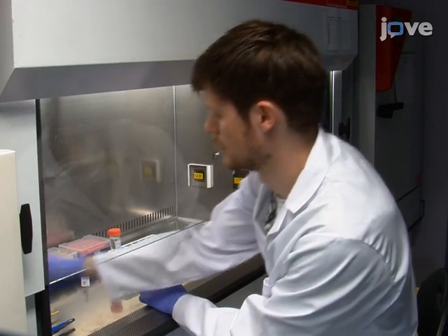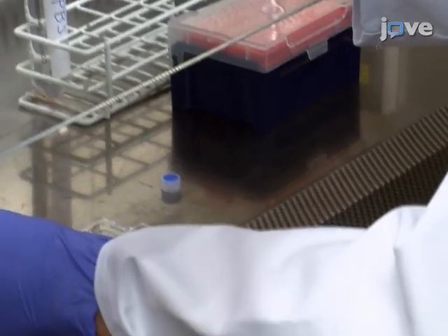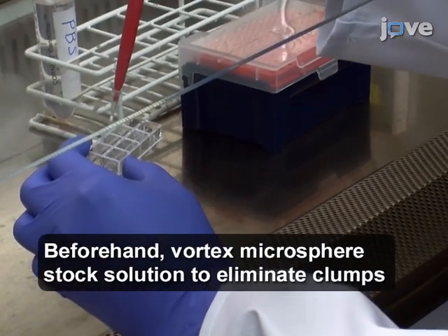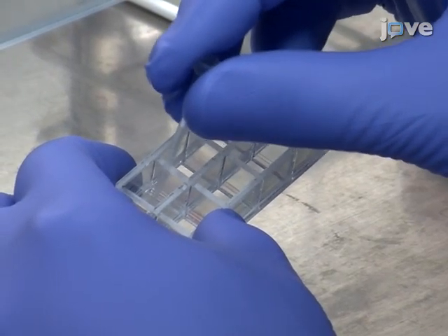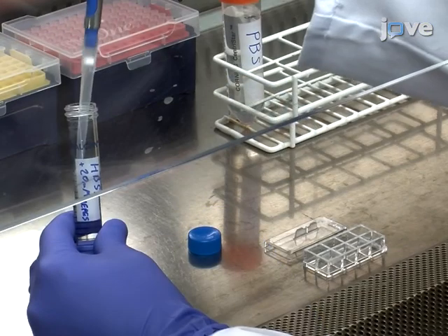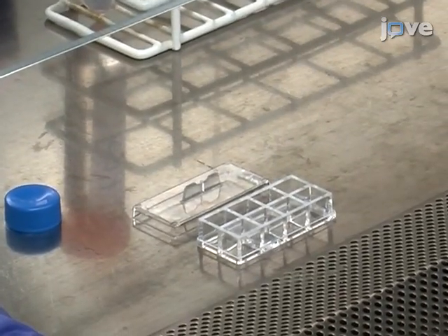For a test sample, add 5 microliters of a 100 nanometer in diameter subdiffraction fluorescent microsphere stock solution to the surface of a fresh uncoated cover slip. Then, spread the microsphere solution over the cover slip with a pipette tip and allow it to dry. Add 200 microliters of mounting medium to the test cover slip to prepare for imaging.